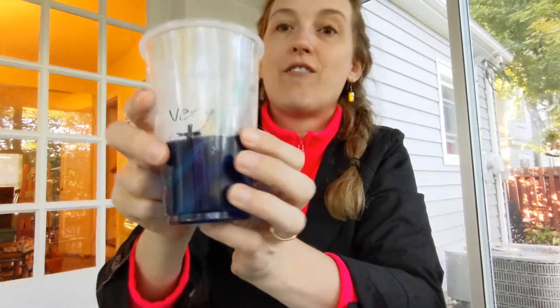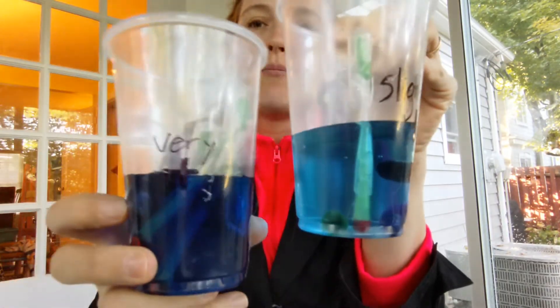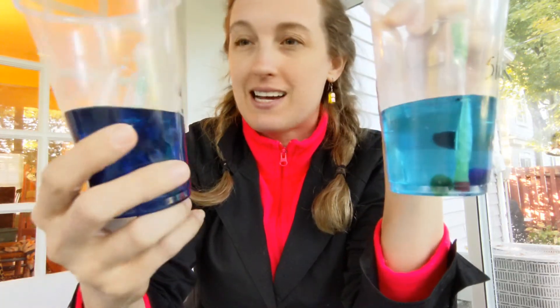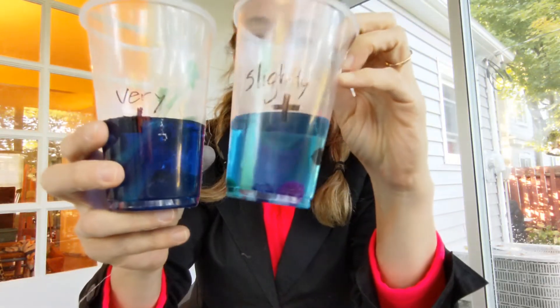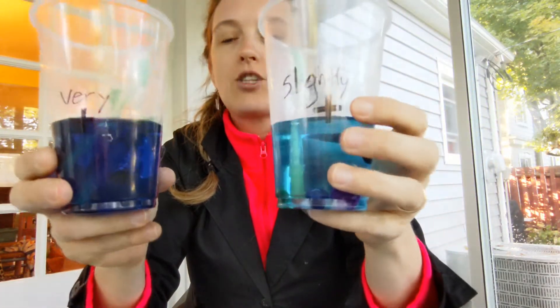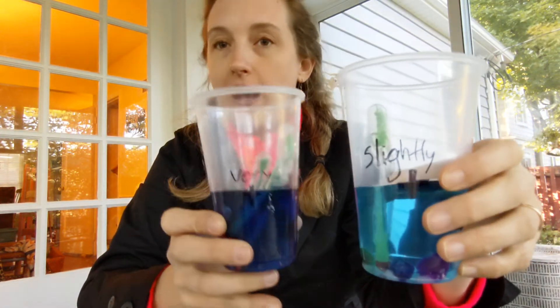Now we do our final sample — we add the substrate and see what happens. If you look at this compared to the last one, we had a lot more antigen, which meant a lot more primary antibody stuck, which meant a lot more secondary antibody stuck with a lot more enzyme on it, which meant a lot more substrate stuck, and we got a lot more chemical reaction. One thing that's great about an ELISA is you don't just get a negative or a positive — you can actually see qualitative differences between positive results, and we can quantify those differences, which I'll show you in a later video.